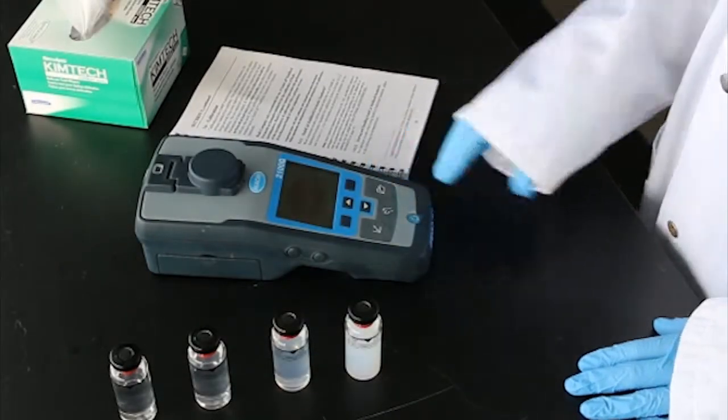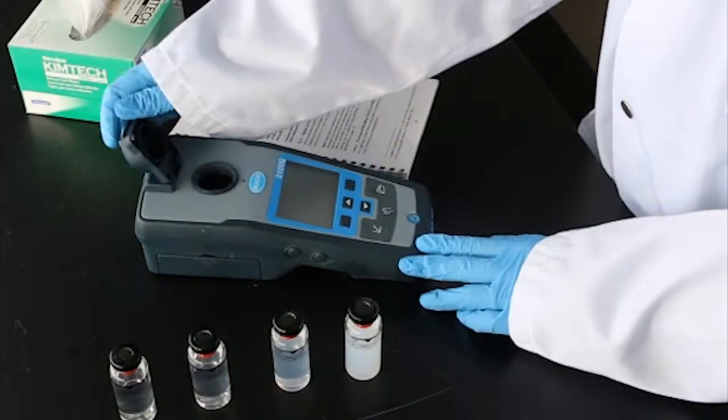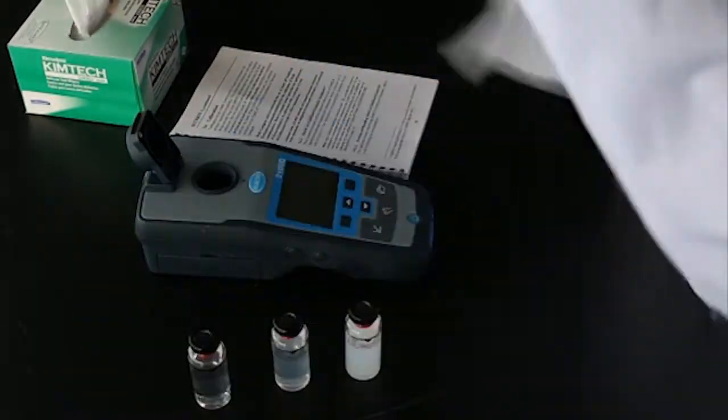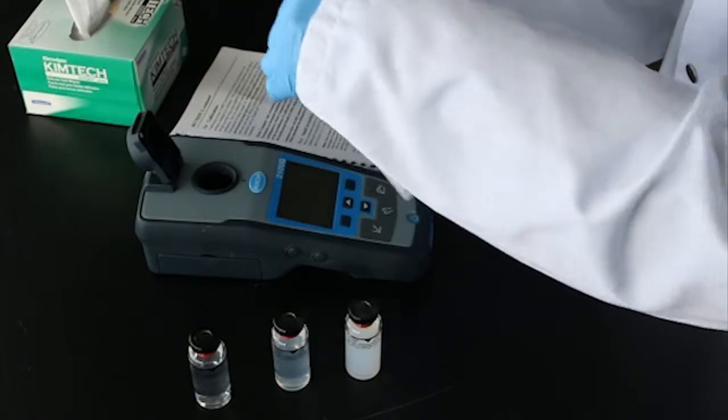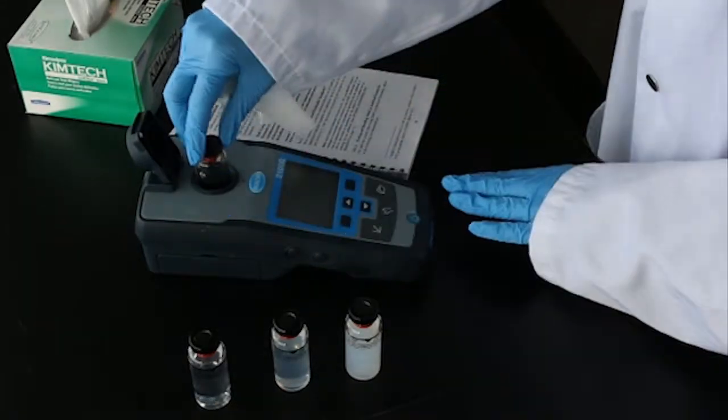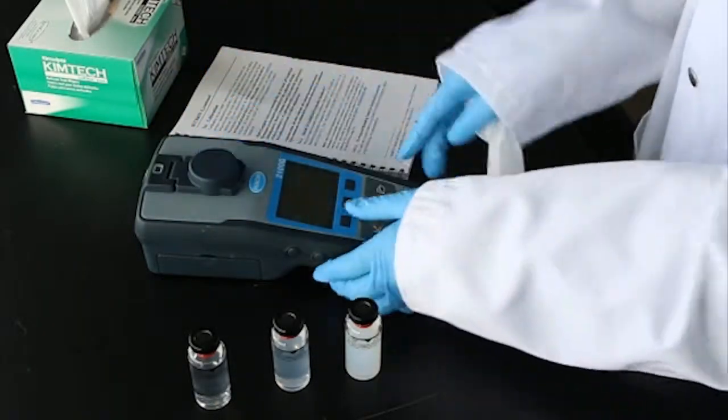Turn on the instrument and follow the manufacturer's instructions for calibration. Primary and secondary standards are commonly used to calibrate and verify each instrument range that will be used.